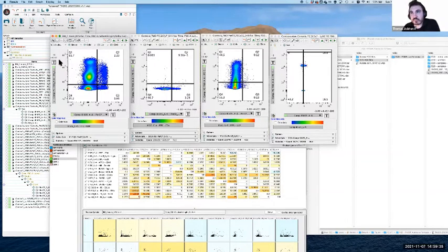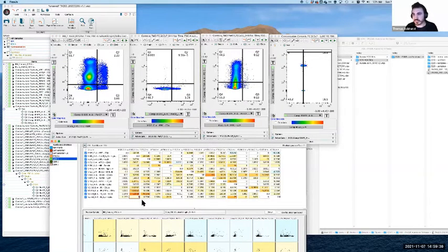Now, in this case, this is reasonably simple. And if we went the other direction, say we turned it up too high, they would all be leaning over to the left. So the starting value is, what did I say it was, 4, something like that? Yeah, so 4 was clearly too high. Typically, we'd walk it down progressively until we can see that we've corrected what this signal looks like. But importantly, we're doing it with reference to the FMO and to the single stain.